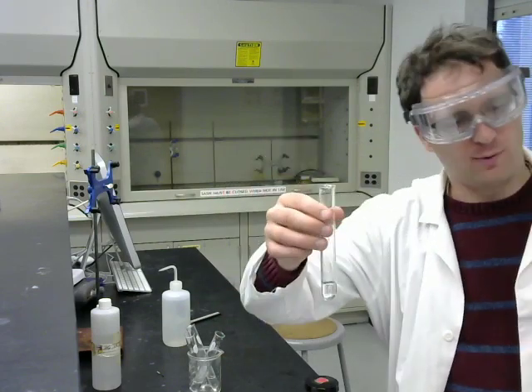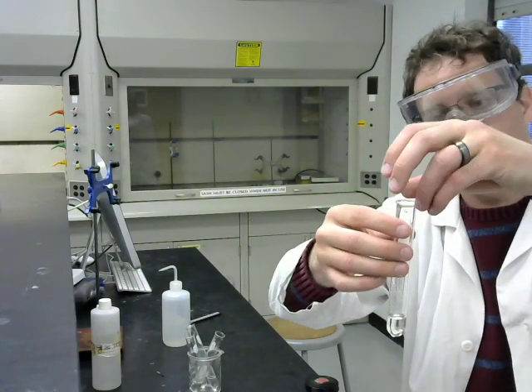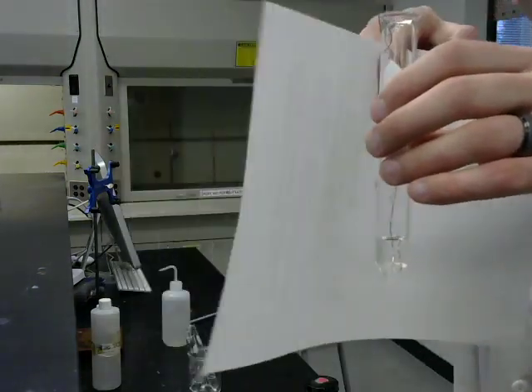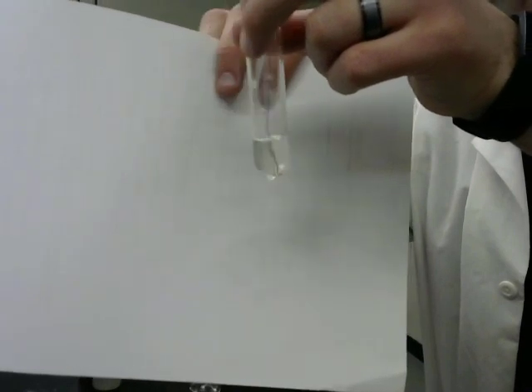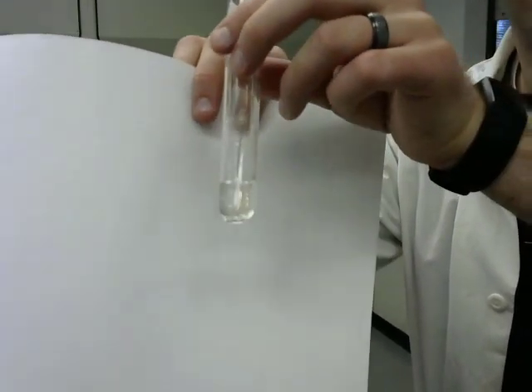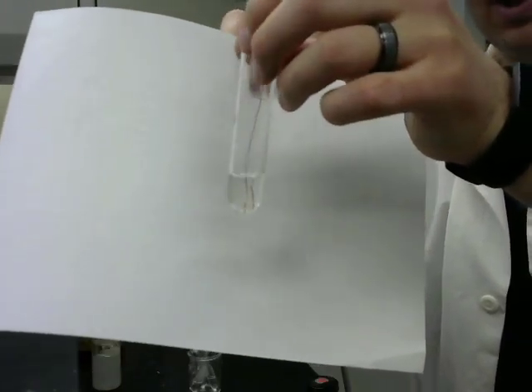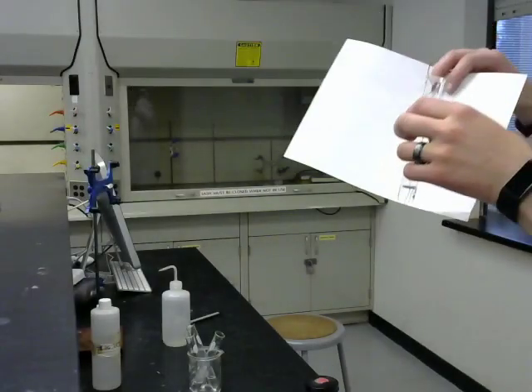So we're going to start with copper. This is just some copper wire, and we're going to put the copper into the hydrochloric acid solution. Let's see what it does. What I see is that the copper maybe is becoming cleaner as crud and corrosion on the outside gets cleaned away by the acid, but the copper wire itself isn't being dissolved at all. So that is copper.